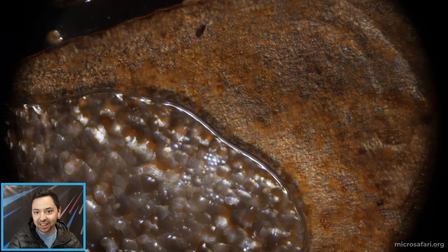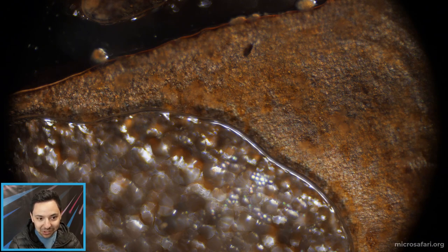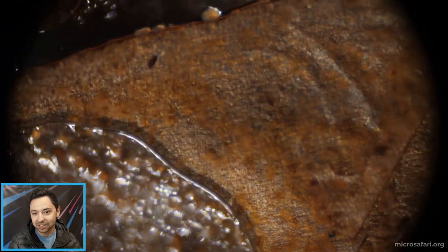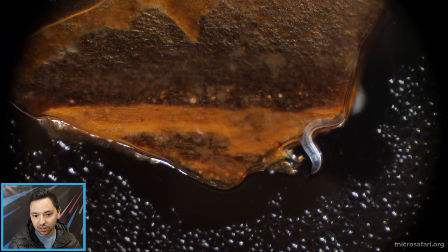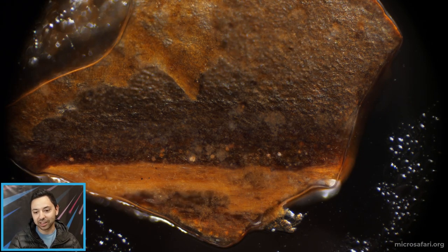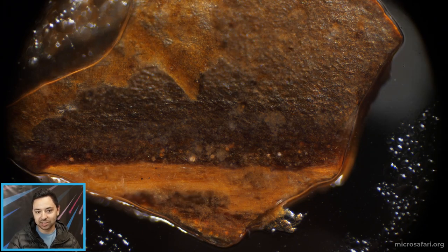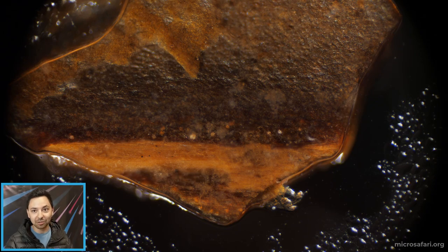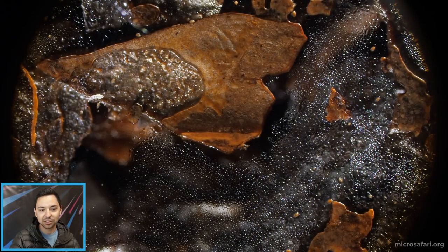This is so cool because these little amoebas have almost like bright gemstones inside them. These guys are probably about the right size that they would eat bacteria — we can't actually see bacteria at this zoom level, but of course there are lots of bacteria in here. There's a little piece of dirt, maybe a decaying leaf, that has water sticking to it, and all these organisms are stuck inside the water too. They're kind of trapped in this little water world — the surface tension is just too strong for them to escape.